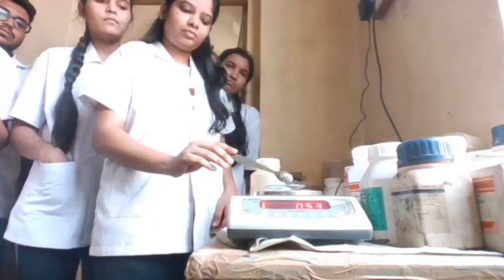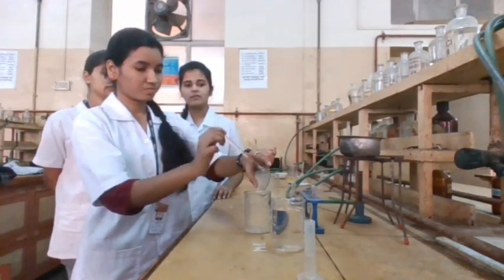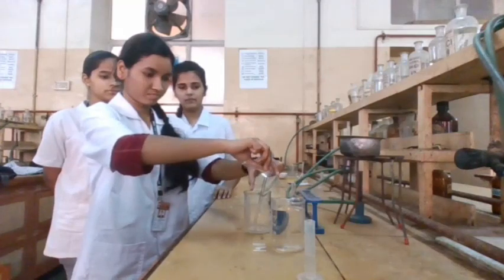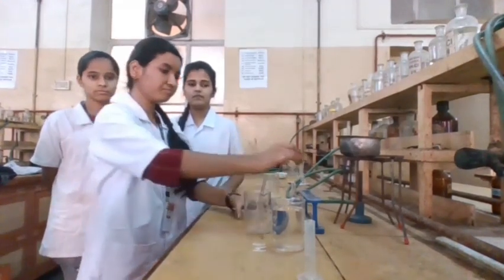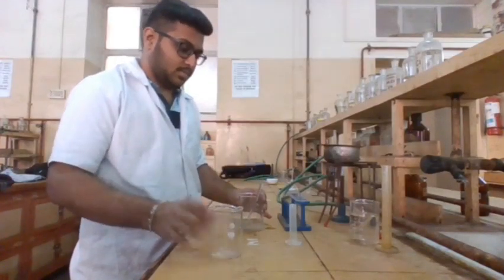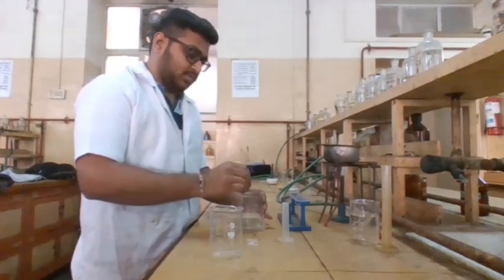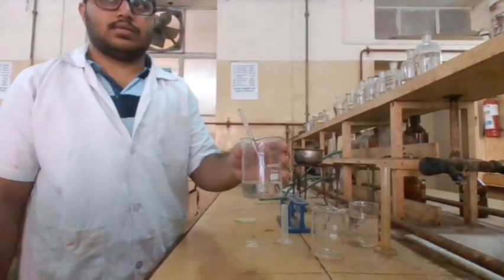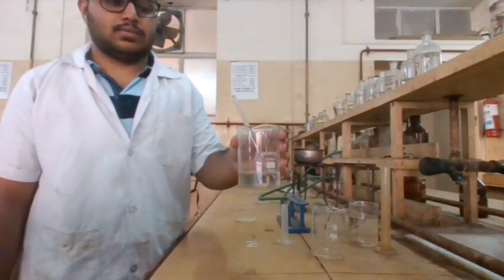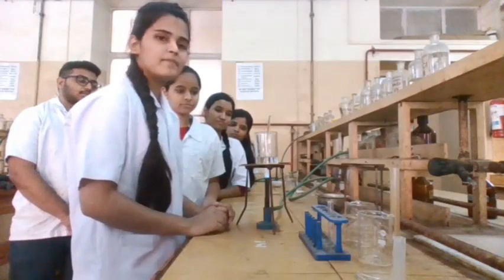Weigh about 0.5 grams of DAP fertilizer. Transfer the sample into a 100 ml beaker and wash the watch glass with a little amount of distilled water. Then add 50 ml distilled water and 2 ml concentrated HNO3 and stir it well. If a clear solution is not obtained, filter through ordinary filter paper and wash with 10 ml distilled water. Here we obtain a clear solution.